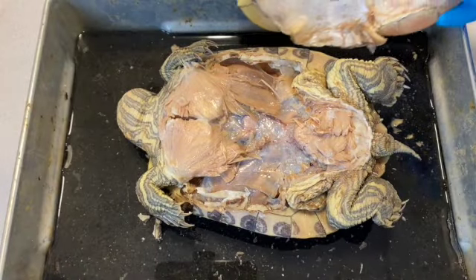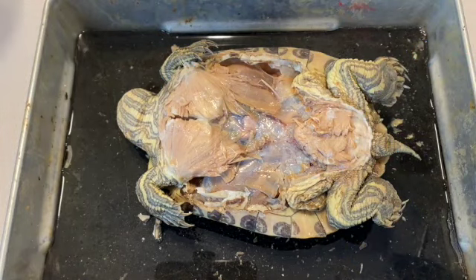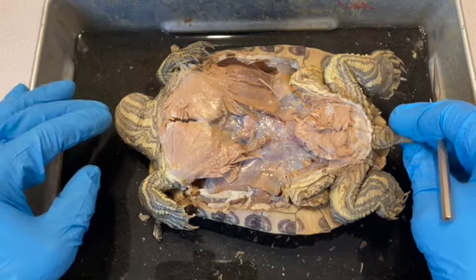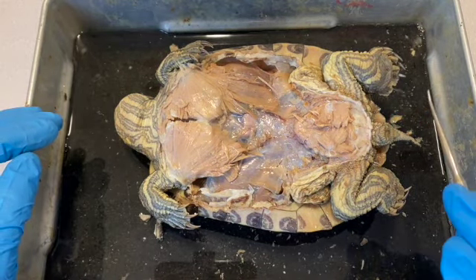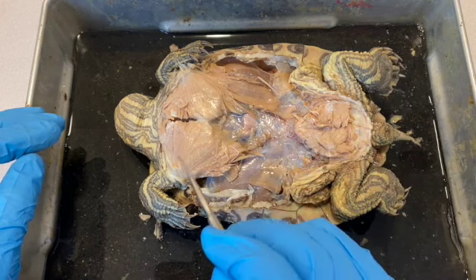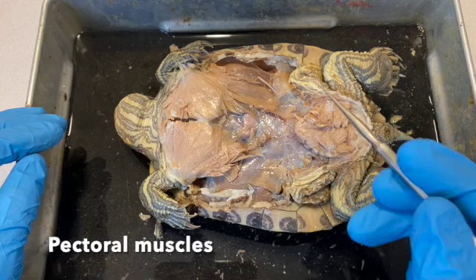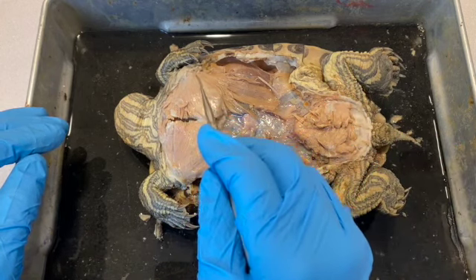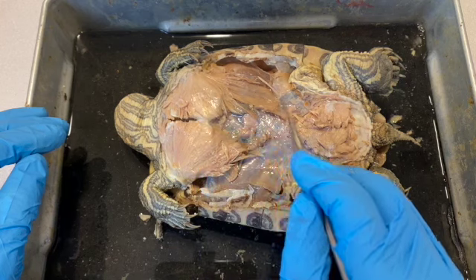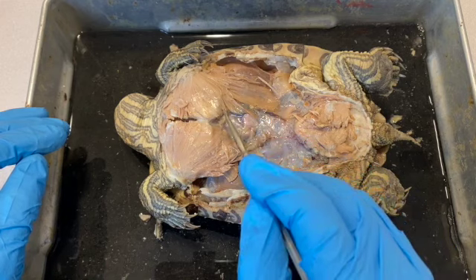So here we have our turtle with the plastron removed. And there are a couple of prominent muscle groups that you'll be able to see. In the anterior end, these large muscles in here are, as you might expect, pectoral muscles. And you can see the attachment, the insertion point is up here, and they extend all the way down here, and they're also attached to the plastron.